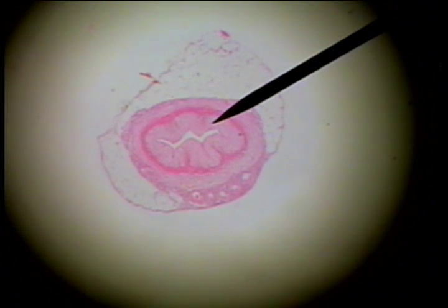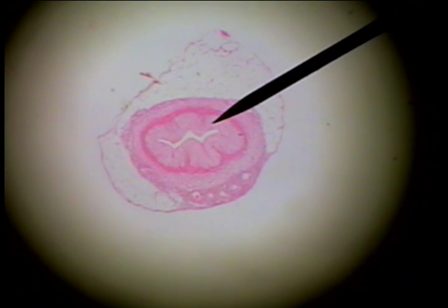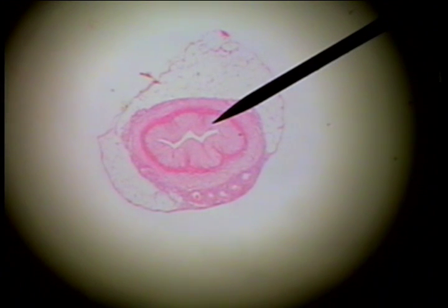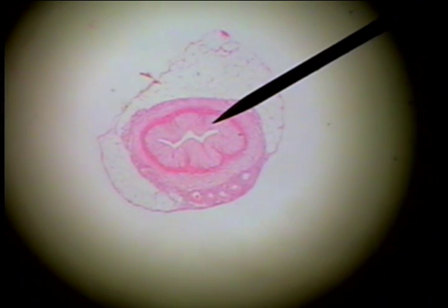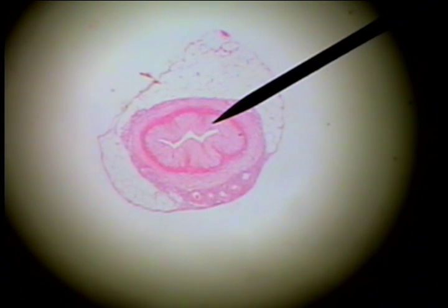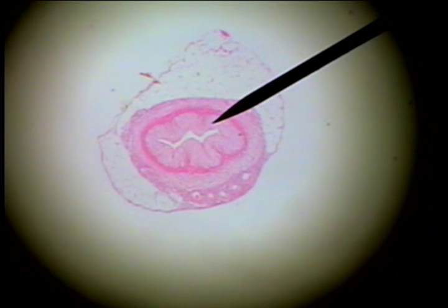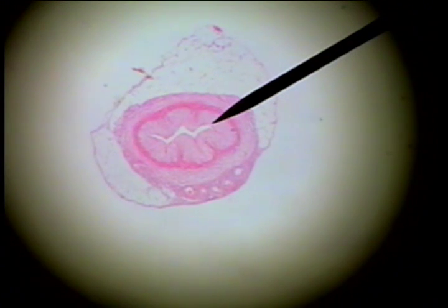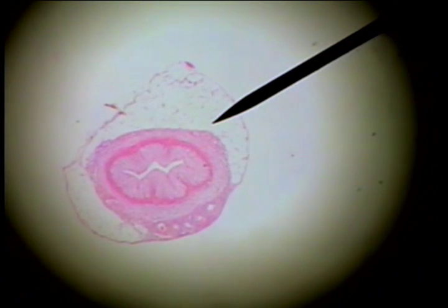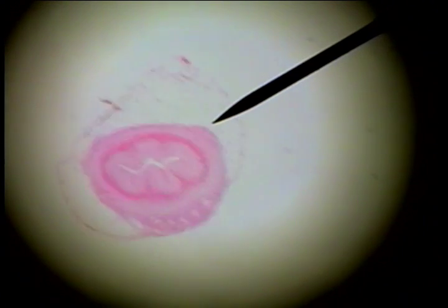The ureter is a tubular, thick, muscular wall tube that conducts urine from the calyx of the kidney to the urinary bladder, characterized by some adipose around the periphery as we expect to see it.